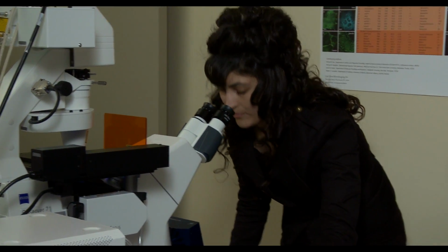It's really easy to use the facility. They have a really great setup with the Google Calendar. Because we have classes and other things during the day, a lot of the time we're doing our research at goofy hours, just being a graduate student. And so having access to a facility pretty much anytime we want, 24 hours a day, is really, really helpful. And that's where the faculty members have been really, really helpful. And anytime we've had questions, we can go to them and they're always more than willing to answer our questions.